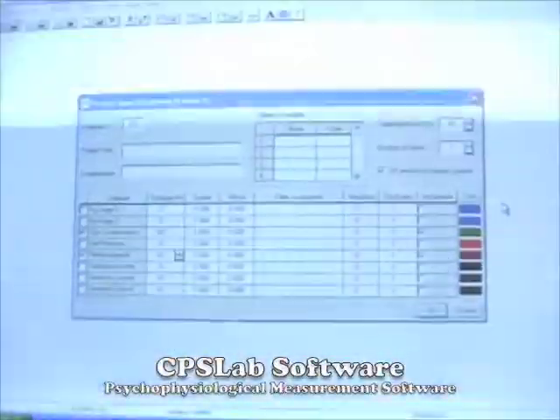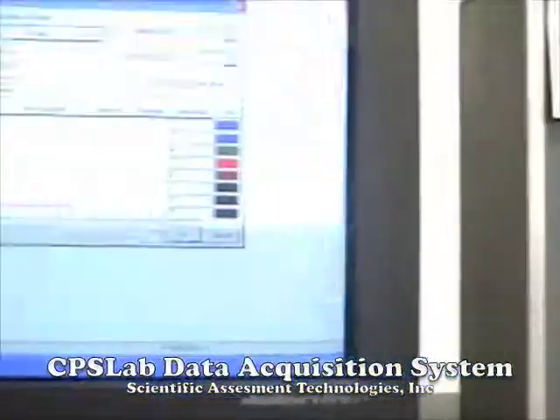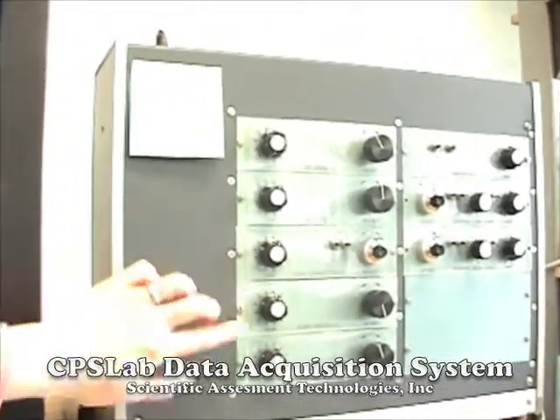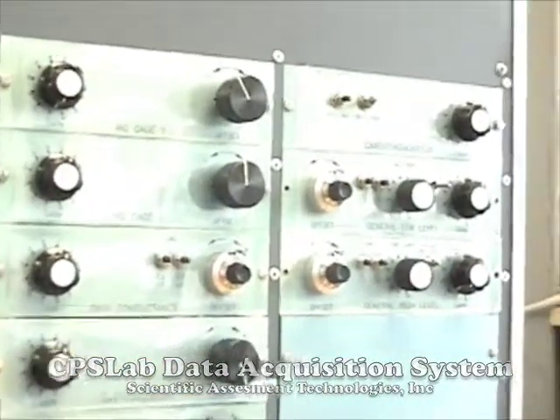CPSLab is a program that we use to collect physiological data. So it interfaces, we have two options. So we have this little blue machine over here. So this machine, we can collect respiration. So we have two channels of respiration. We have skin conductance. We can collect blood pressure, the plethysmograph, and also the cardiotachometer.